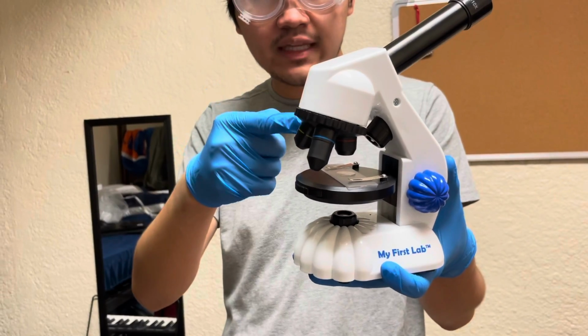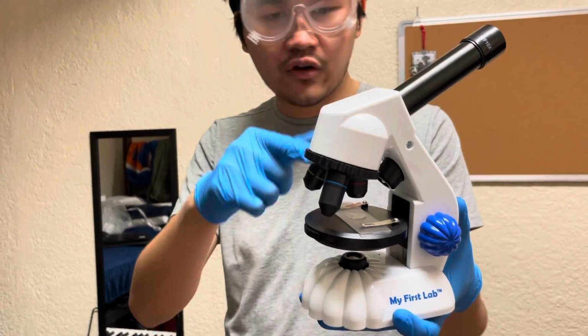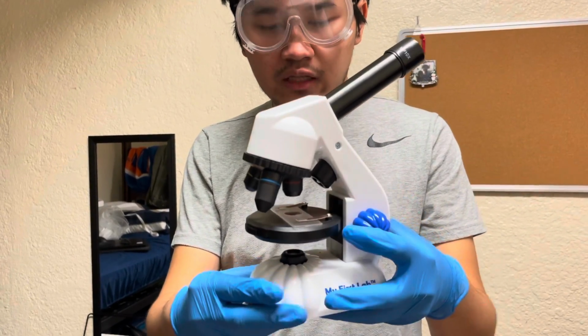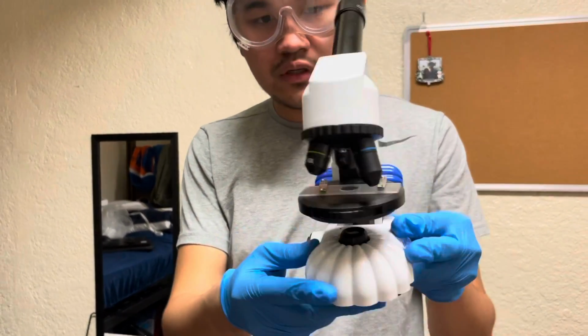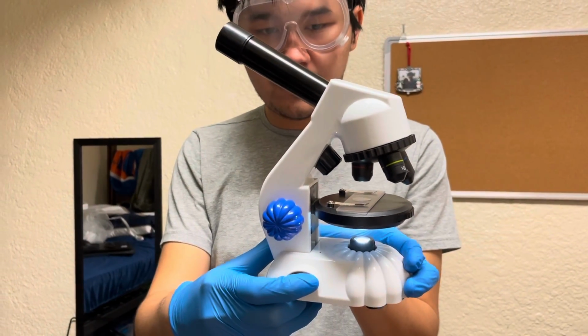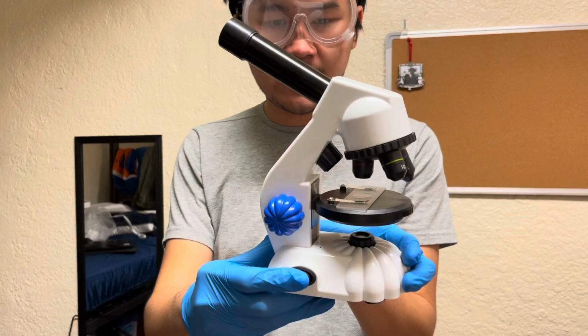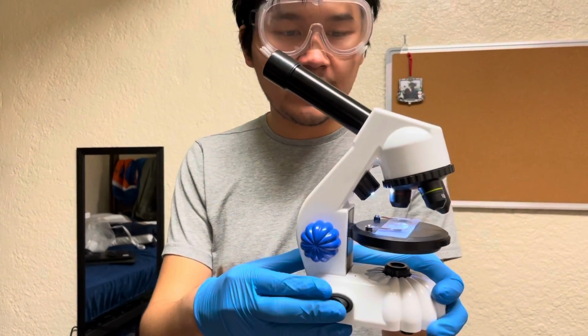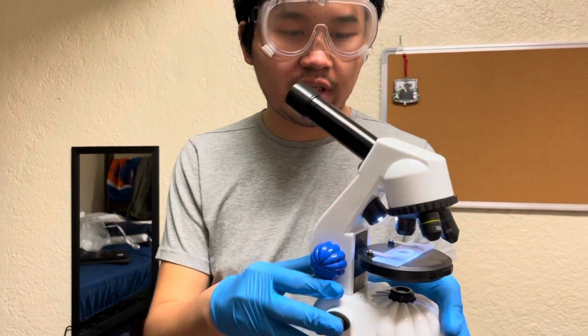And note that I have my objective lens on the lowest magnification. You need to always have it on the lowest magnification for this part. So keeping it on the lowest magnification, I'm going to turn on either illuminator. For me, I am able to visualize the microbes best with the top illuminator, but whatever illuminator you use will depend on the sample that you're viewing.